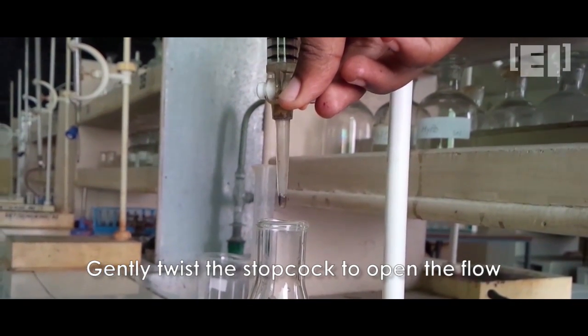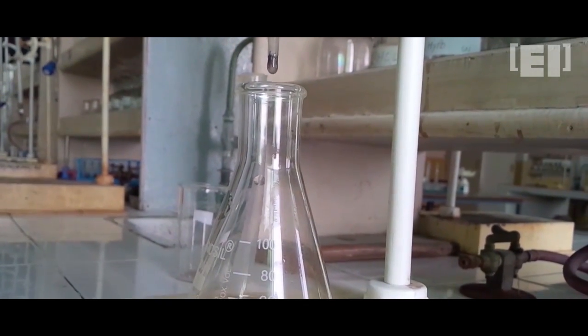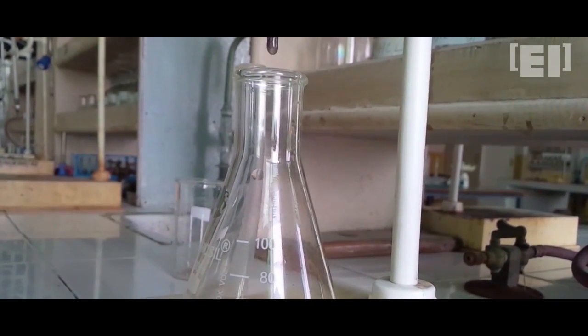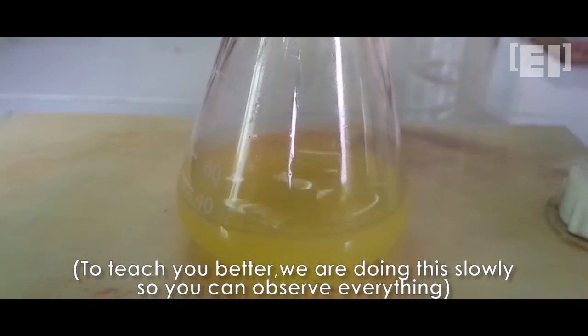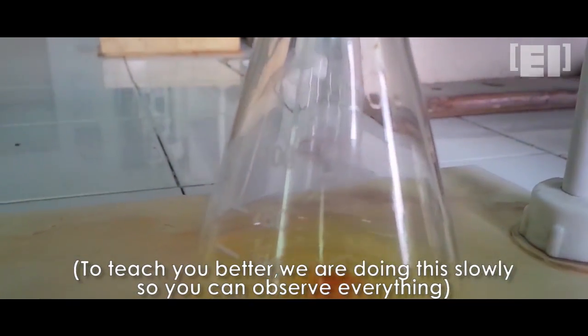Open the stopcock of the burette. We are doing the titration slowly to let you notice the color change.